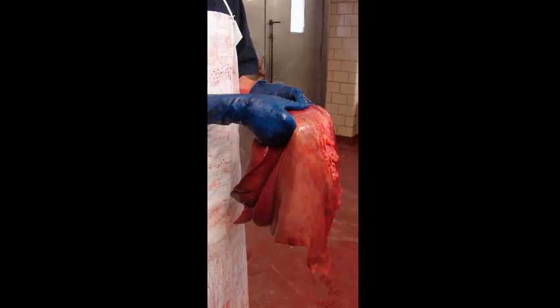We've had tremendous stromal collapse. All that's left is the fibrous connective tissue and the bile ducts. So the hepatocytes, those big cells that give body to the liver, are all gone. So it just sort of flops around in your hand. This animal probably had severe neurologic disease, was head pressing, hyperammonemic, was blind. Okay, just massive hepatic necrosis and failure.